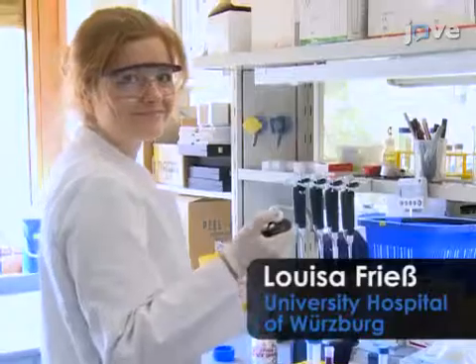The main advantage of this technique is that it can be accomplished with standard microscopy equipment without need for a commercially available complete stereology setup. Demonstrating the procedure will be Luisa Fries, a technician from my laboratory.